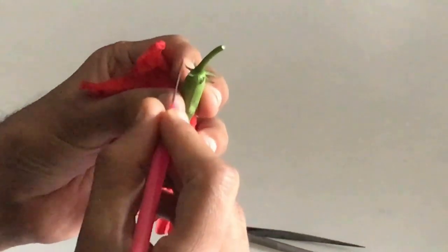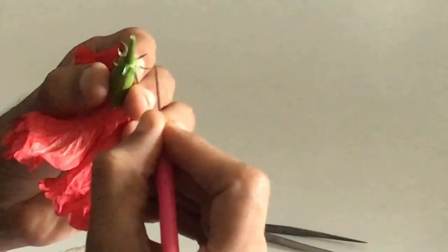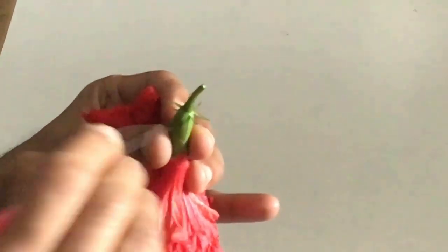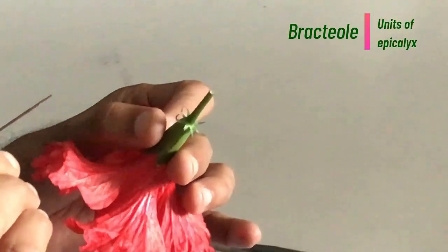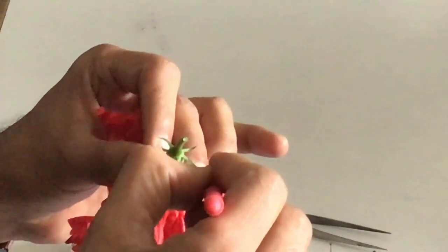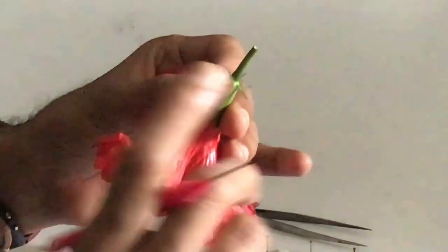The epicalyx is made up of one, two, three, four, five, six, seven units. Each unit is called a bracteole. So these bracteoles make up the epicalyx. One unit is called a bracteole.